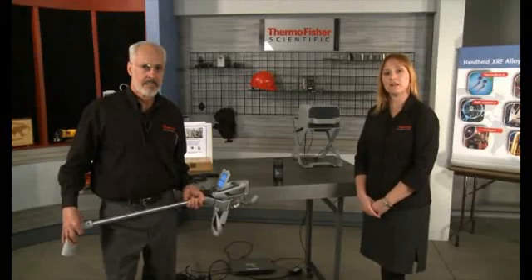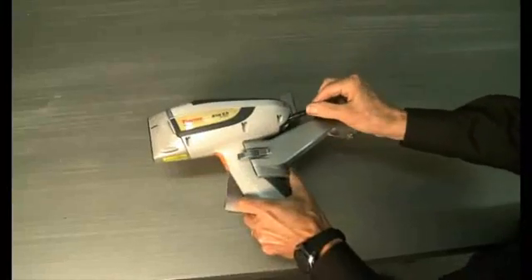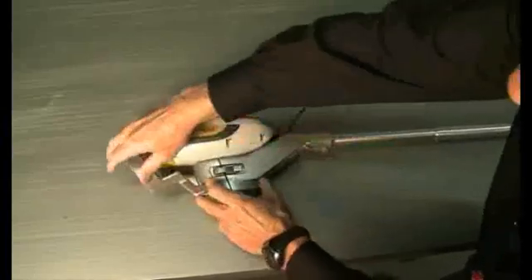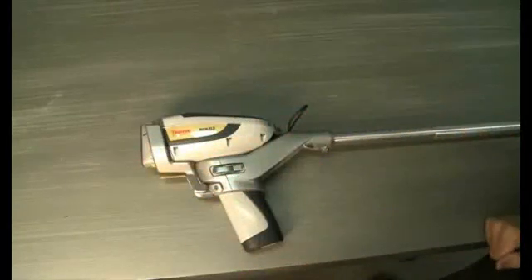Place the handle of the Niton XL3 loosely inside the clamshell grip of the Extendipole. Plug the cable of the Extendipole into the remote trigger port. Make sure you plug it into the proper port on your analyzer, as shown here. Clamp the clamshell tightly around the handle of your Niton XL3.